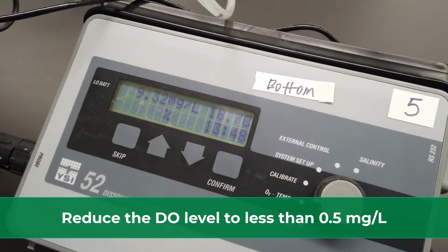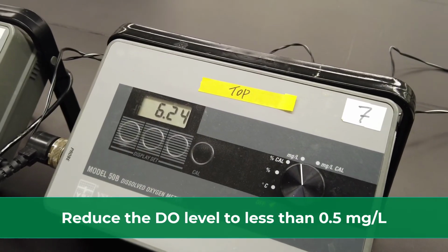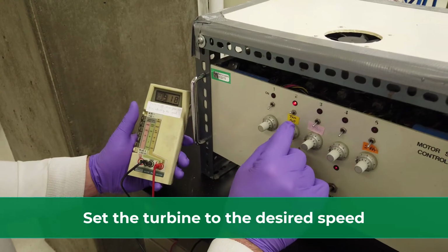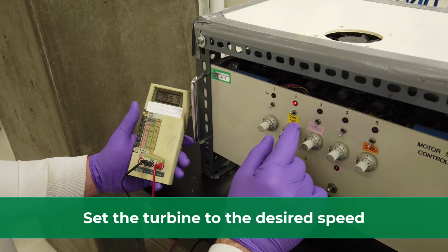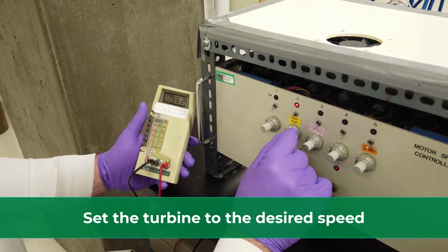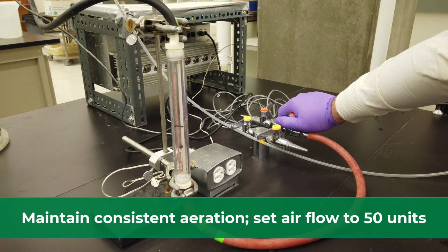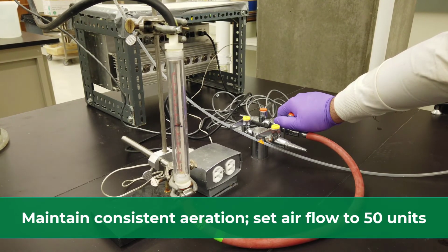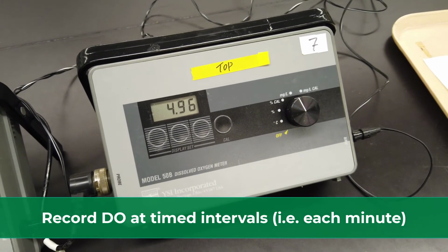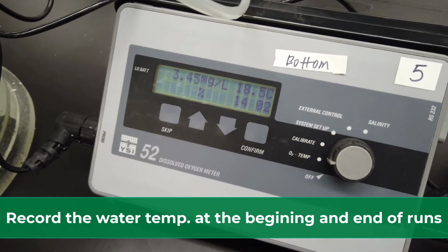Prior to each test run, reduce the dissolved oxygen level to less than 0.5 mg per liter by mixing the sample while sparging with nitrogen gas. Set the turbine to the desired speed using the motor speed controller, MV equals RPM. Maintain consistent aeration for all tests. Set airflow rate to 50 units, 98 milliliters per minute. Record DO at timed intervals, i.e. each minute, throughout the run. Record the water temperature at the beginning and at the termination of each run.